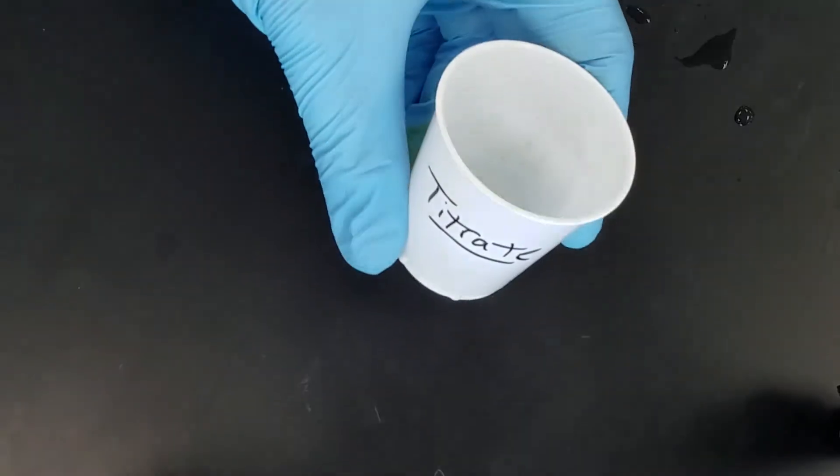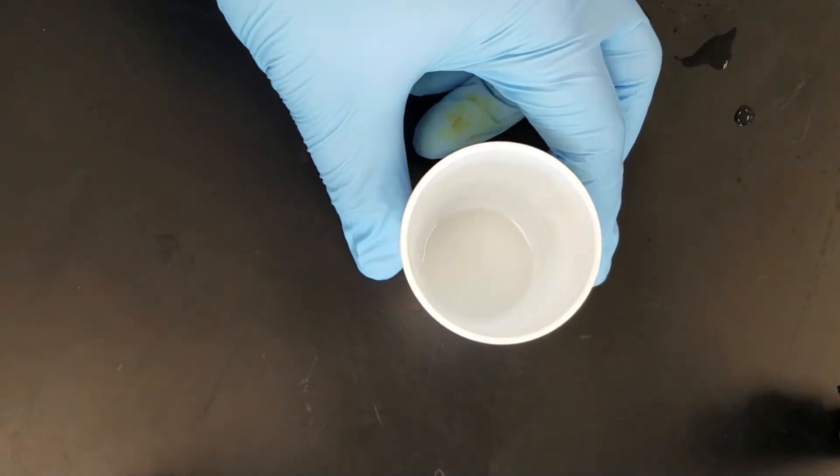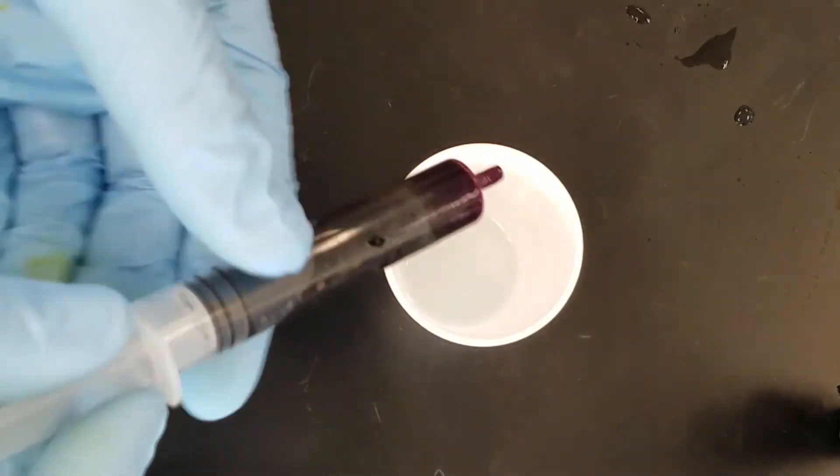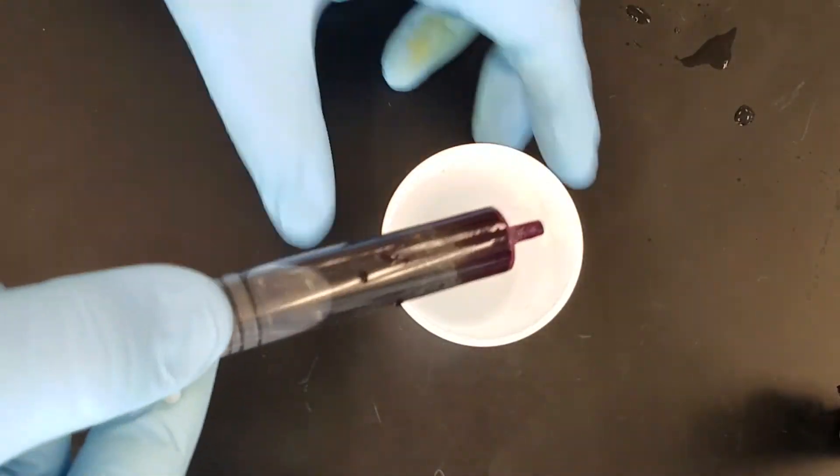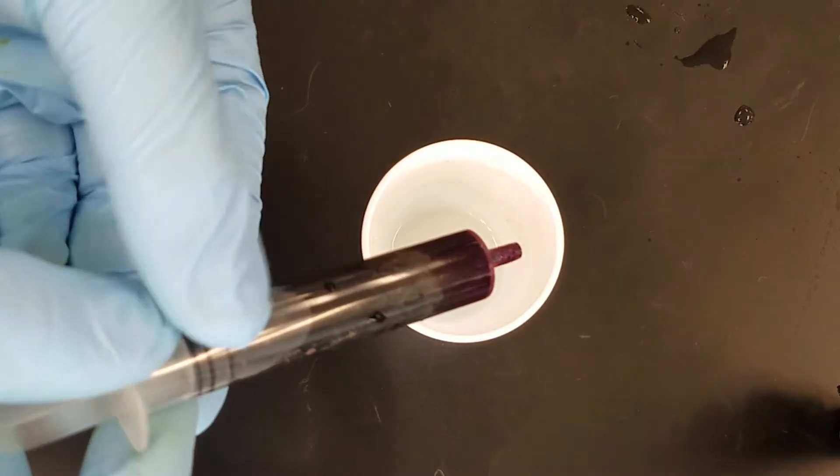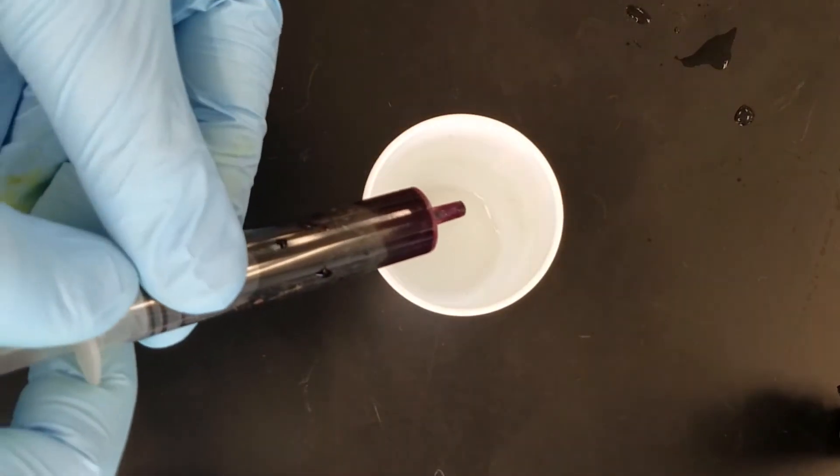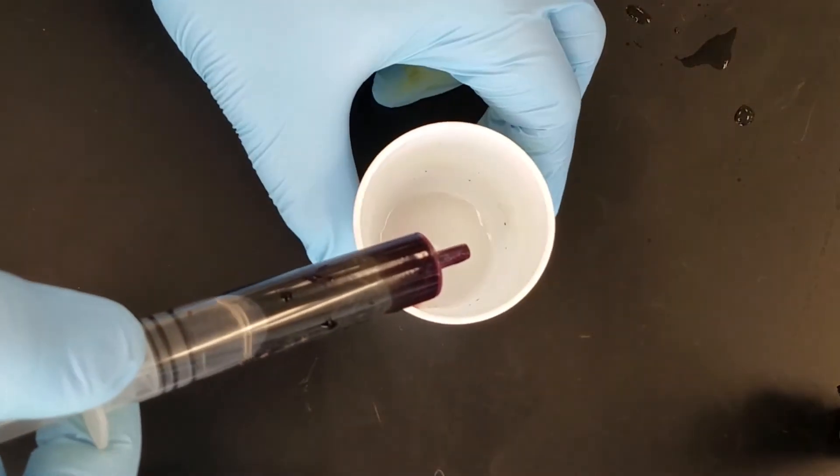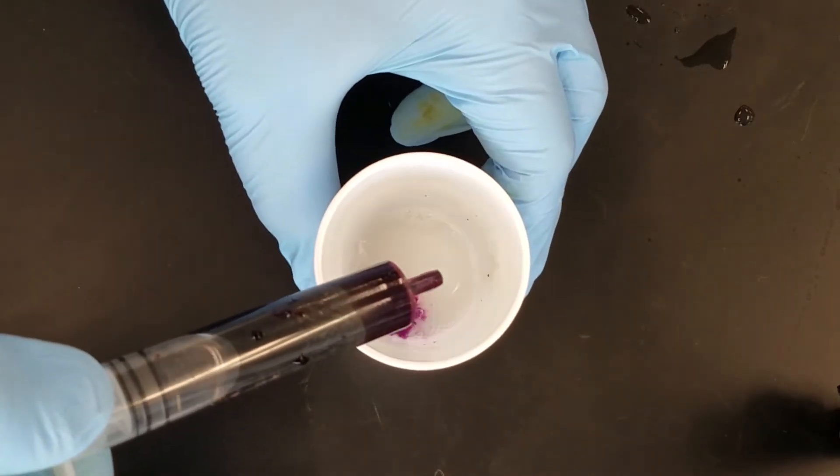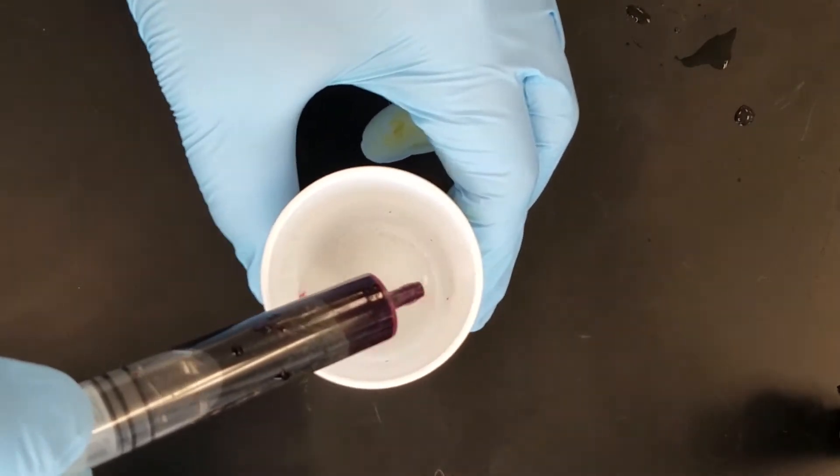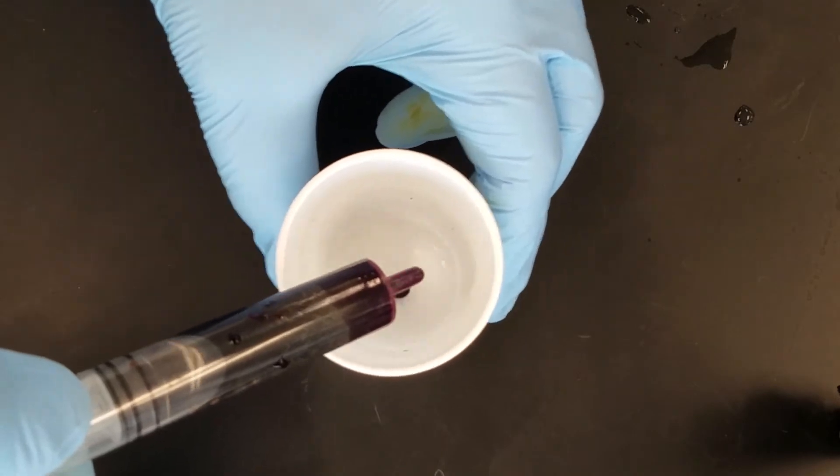To titrate, bring in your cup and then set it down. Titration is a very careful process. I like to hold it like this in my hand, but you could hold it like this and have somebody swish it around. But notice when I put a drop in there, it changes colors and that's because the potassium permanganate is reacting with all the free hydrogen peroxide.